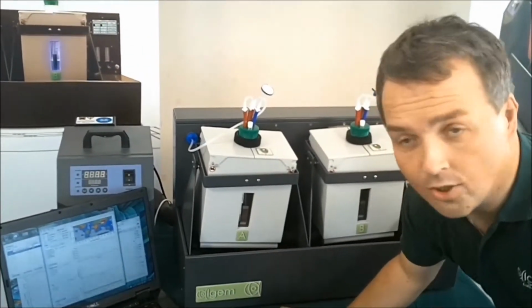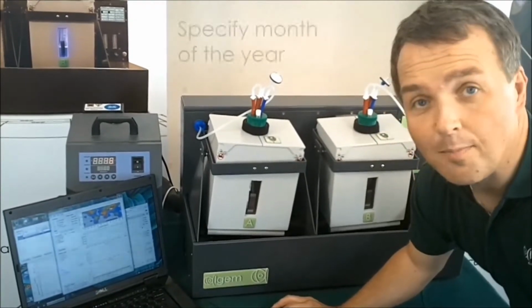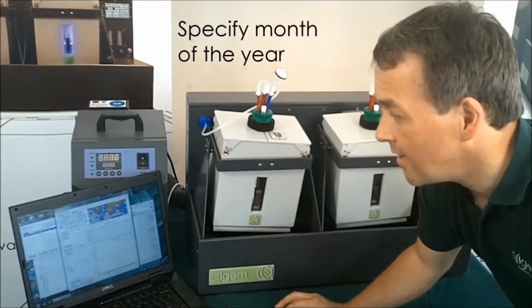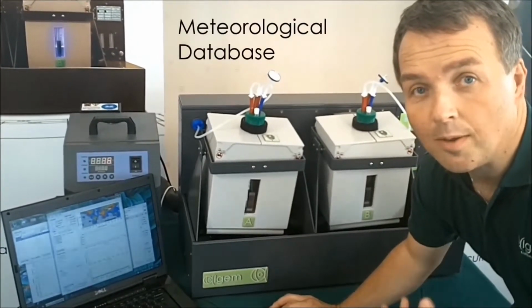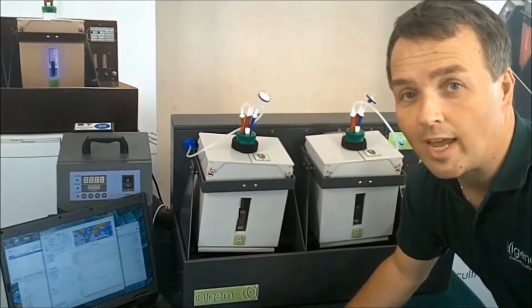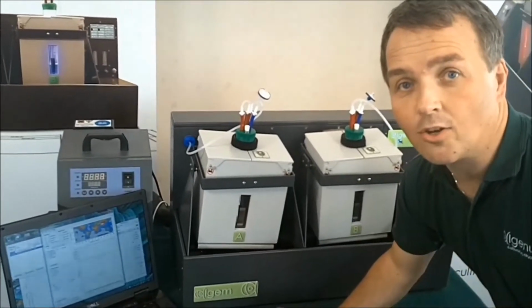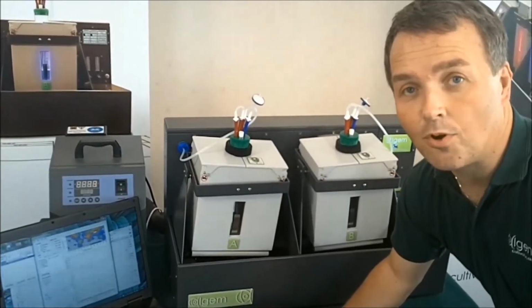You can select a longitude and latitude, for instance, for a desired location, and you can specify a month of the year. When you do that, the system will pull up, using a meteorological database, the lighting conditions and the temperature conditions for that time of the year, for that location. For instance, I can put in a longitude and latitude for Hawaii, and I can do the same for Helsinki and create two different profiles.